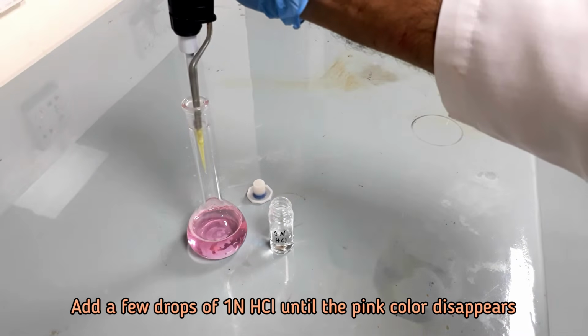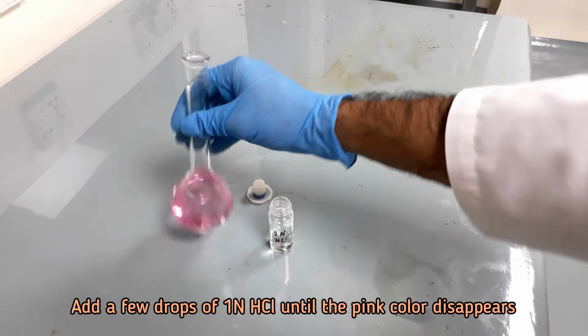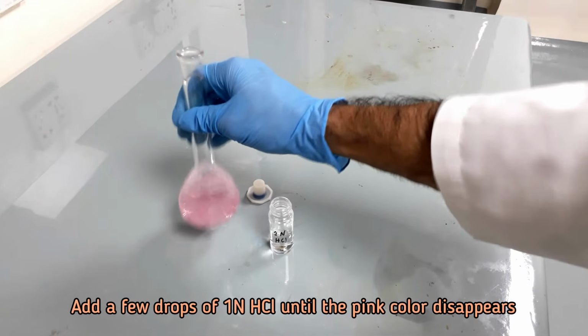Add a few drops of 1 normal hydrochloric acid until the pink color disappears.